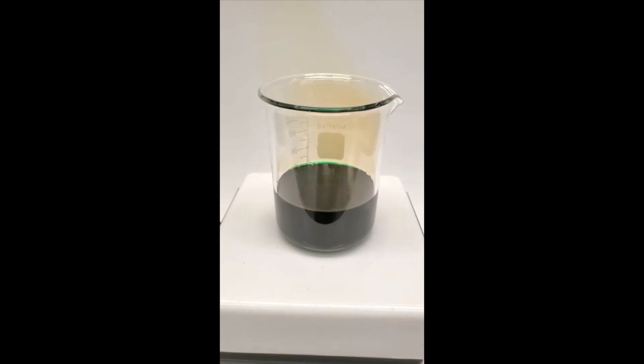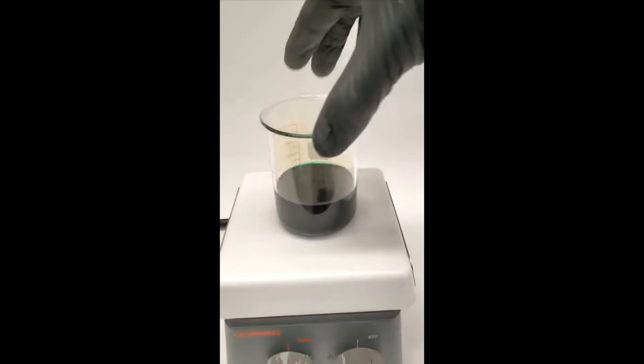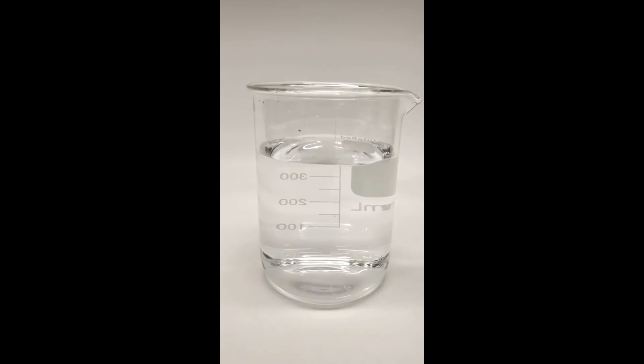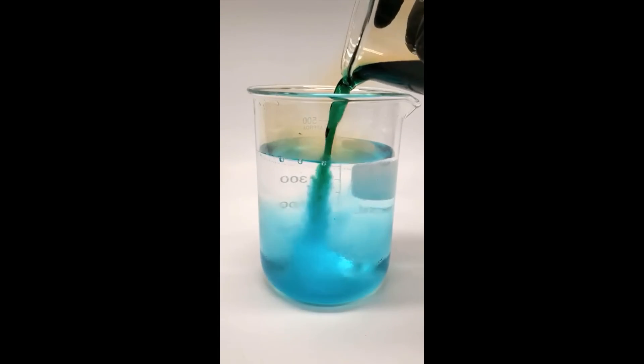It took about 10 minutes, but the penny is completely gone now. The color is also green because of the copper nitrate that formed. If I pour more water into it though, it instead makes a really nice blue color.